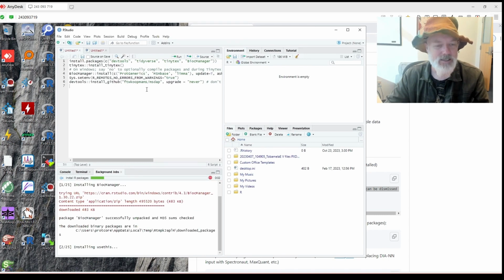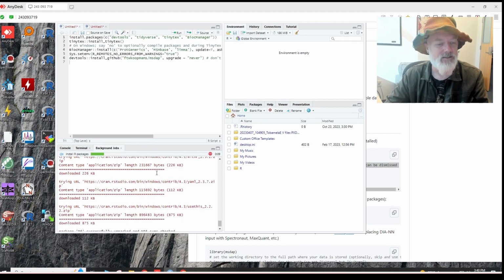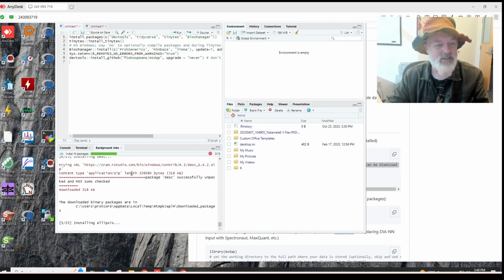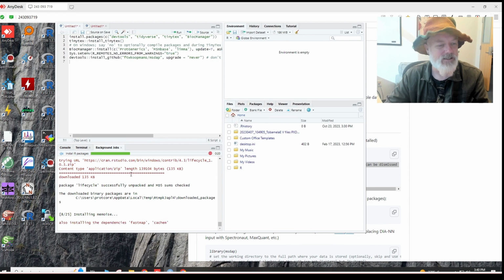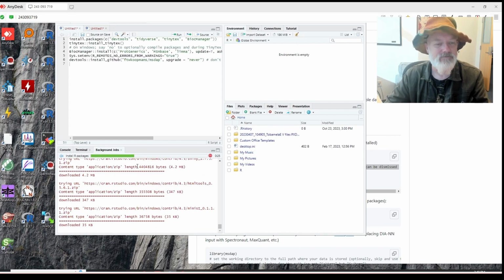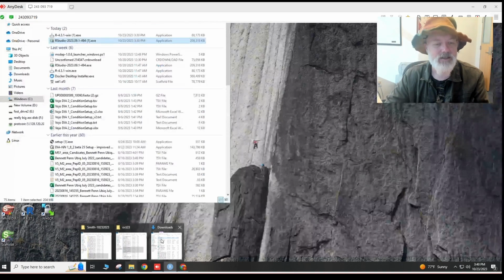Half the time this works, half the time it doesn't. R can be kind of finicky sometimes, but so far so good. Okay, so it's installing all the packages. It's just insane how many packages these things need. I'm surprised it works at all. Okay, so anyway, halfway done installing the packages. In the meantime, let's hope this works.